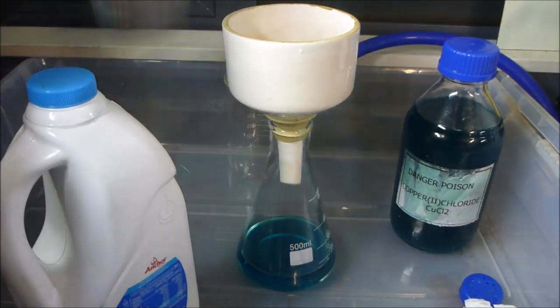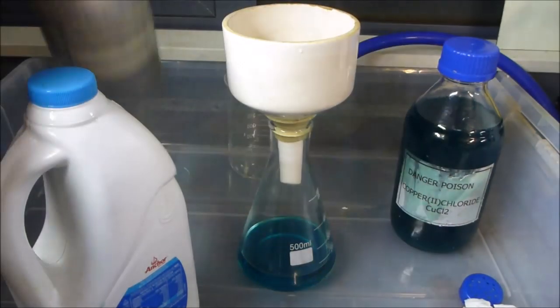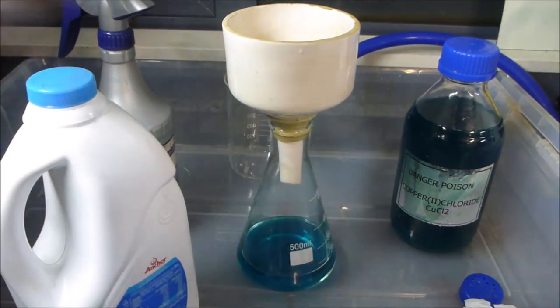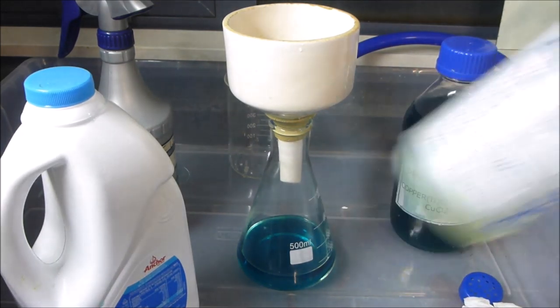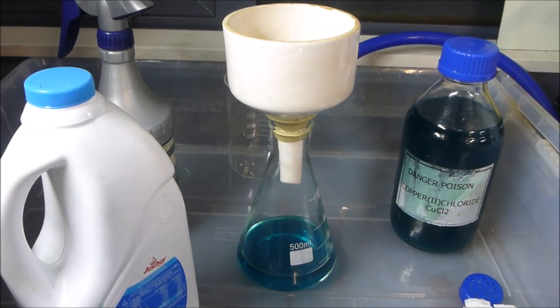The other trick is I have a wash bottle, a spray bottle that is specifically for this process. So the filtered solution from that I pour into the spray bottle, and then I use that to clean out things like the big bucket. So that way, I do use a little bit of fresh water, but the wash solution only very slowly accumulates. So there's very little solution to get rid of here.